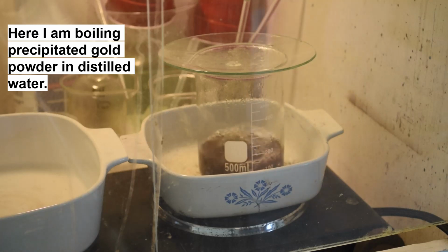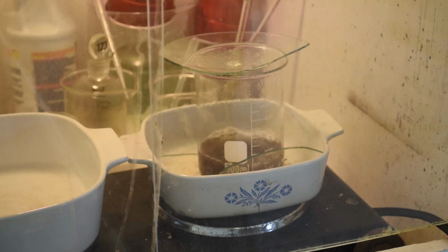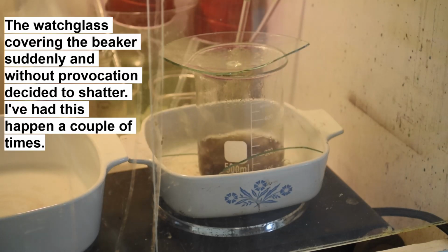Now we have moved on to distilled water boils. After the last boil, I'll dry the gold out and we'll see if there's enough there to move the scale. It looks like we started out with enough, but uh-oh. Not sure what just happened there.